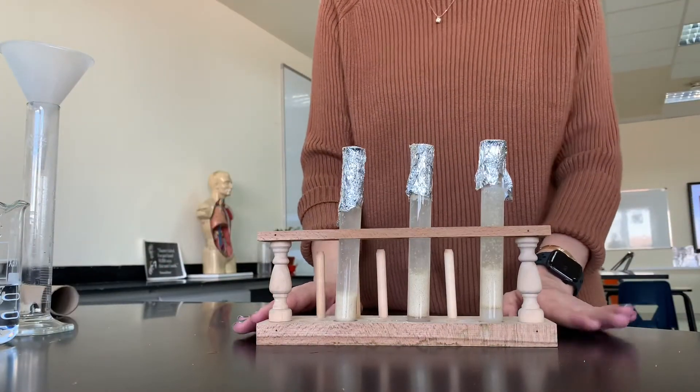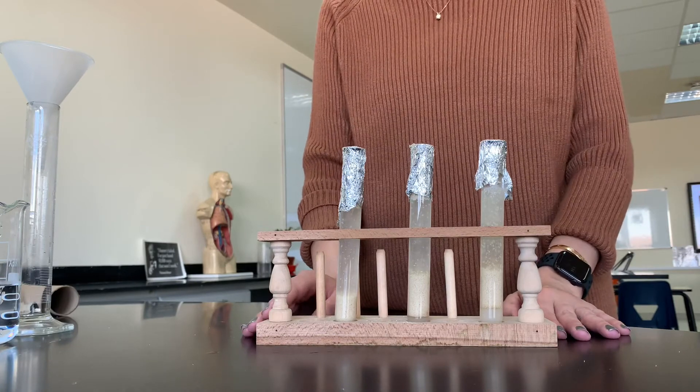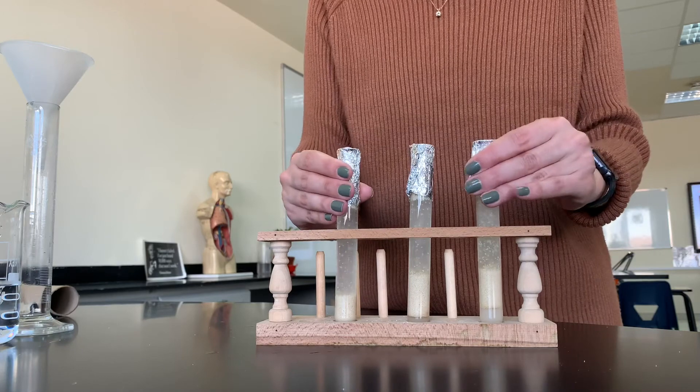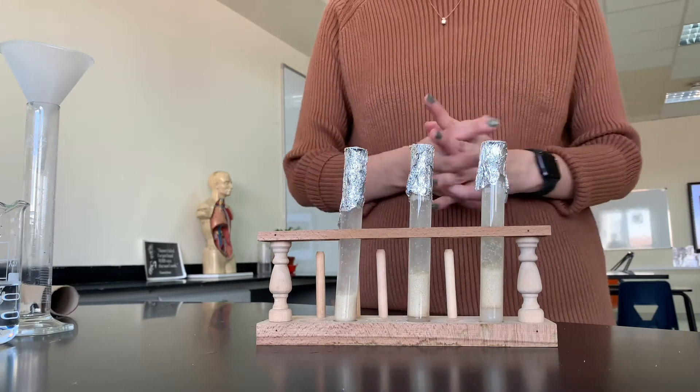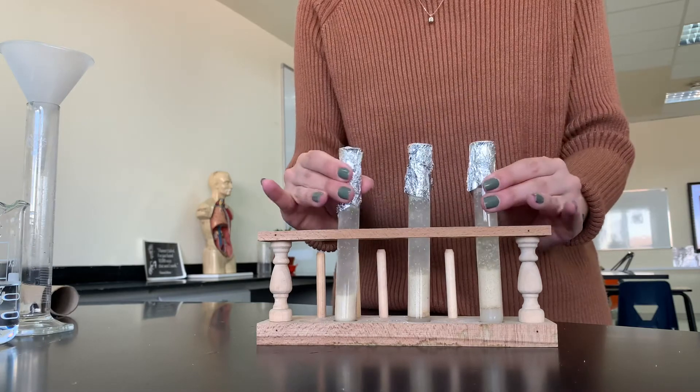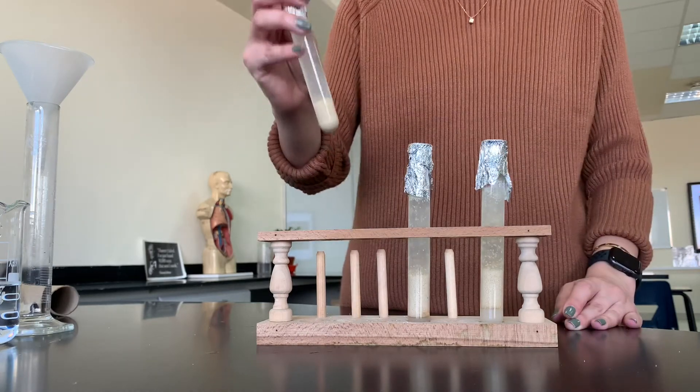Since I'm trying to observe fermentation, which is an anaerobic process, I have covered or sealed the test tubes to create an anaerobic environment, which means I'm trying to prevent oxygen from entering into the test tubes.